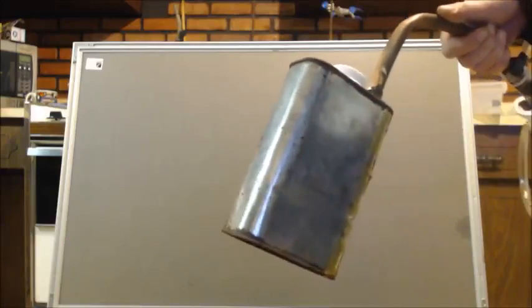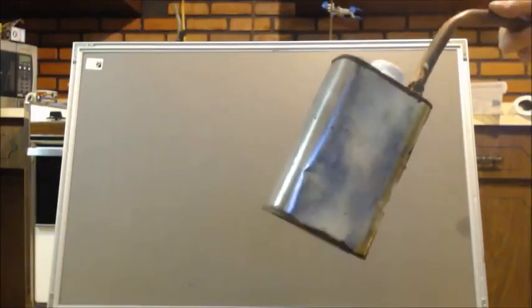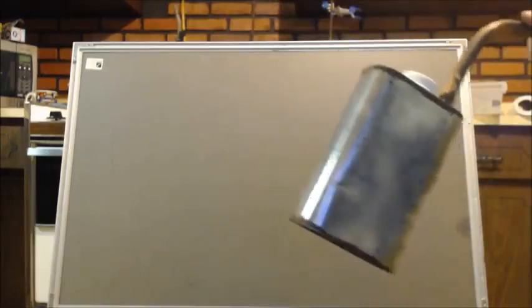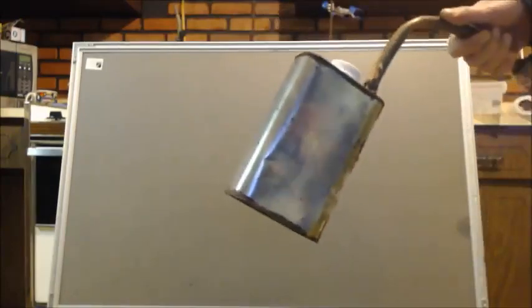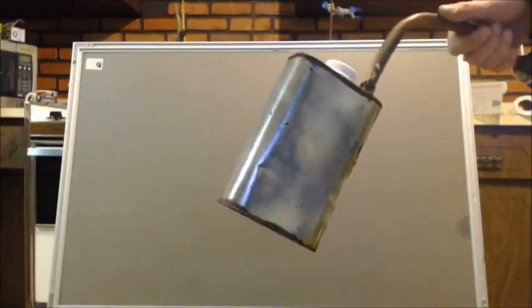I'd epoxy it. And if you noticed in the video, I only distilled water. If you have anything explosive in here and you get a leak, the chances of catching on fire are pretty good. It could blow up. This is the most unsafe thing in the world to do.